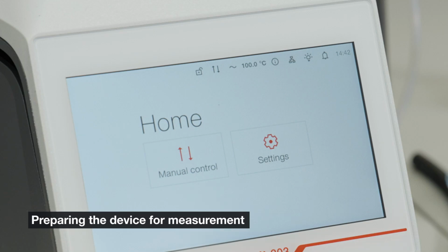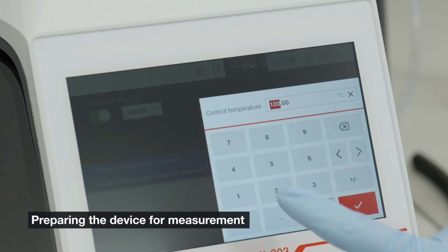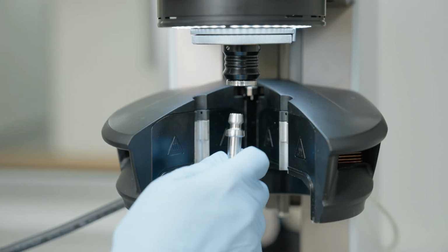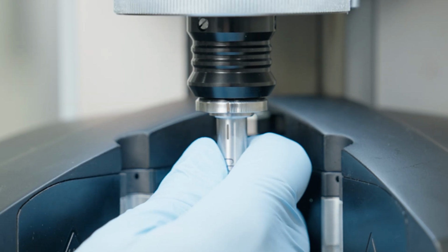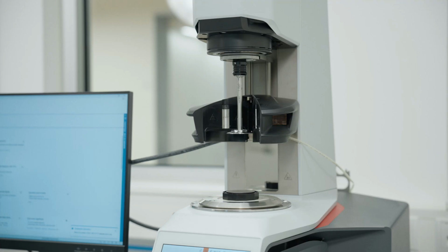In the control panel or on the touchscreen, set your measuring temperature. Wait until the temperature is reached. Connect the measuring system to the coupling. When connected correctly, an audio signal sounds and the name of the measuring system appears in the control panel.